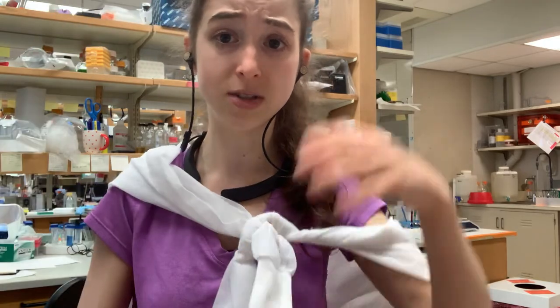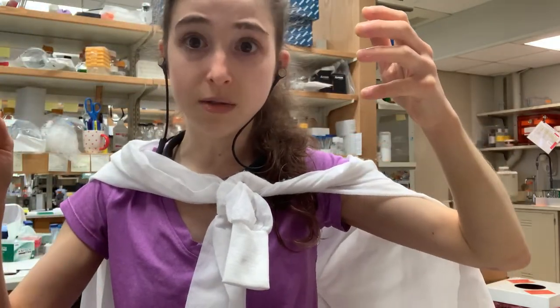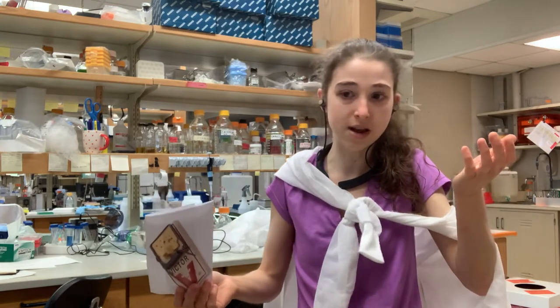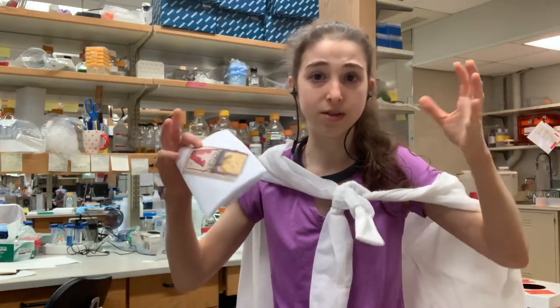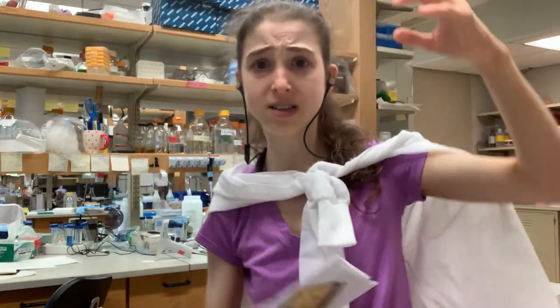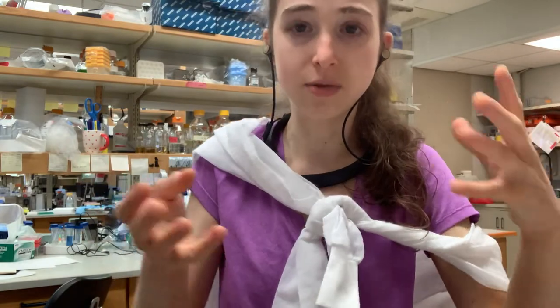There are different cross-linkers with different strengths. I'm trying glutaraldehyde, which is very strong, so I'm trying it at 0.01% because at 0.05% it was almost all stuck in the wells of my SDS-PAGE — it had all aggregated. The issue is you're adding mousetraps everywhere onto all the lysines. Lysines are normally positively charged and hydrophilic, so they hang out on the outside of proteins and come into contact with more stuff, leading to a lot of random cross-linking from fleeting interactions.